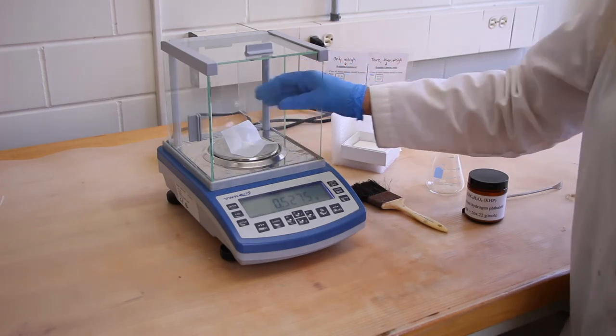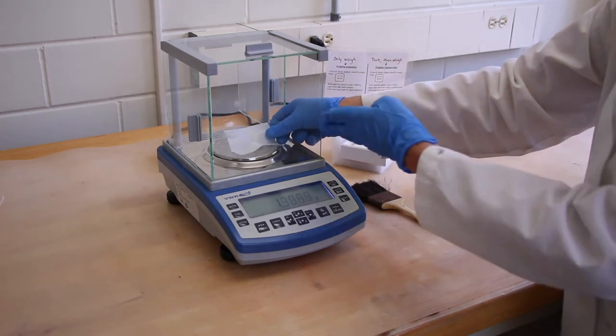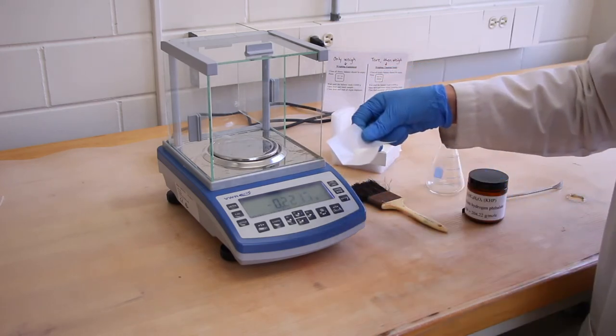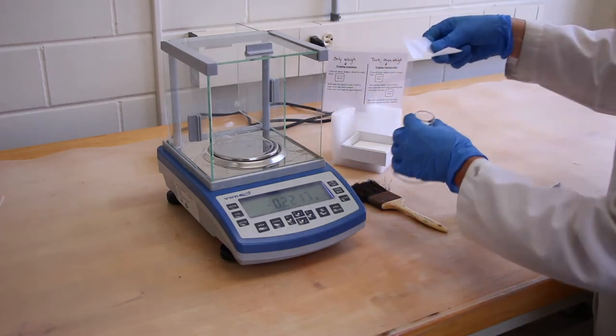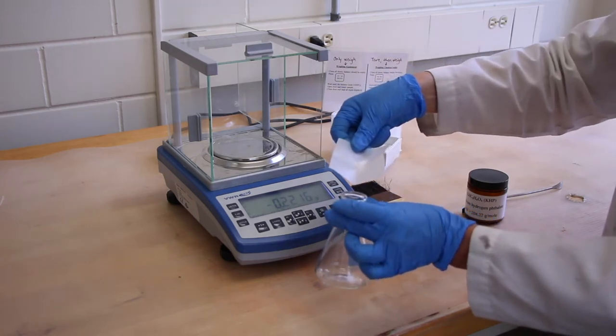The solid has fallen into the center, and we can easily grab it by a corner, and then put it in the vessel that we need to put it in.